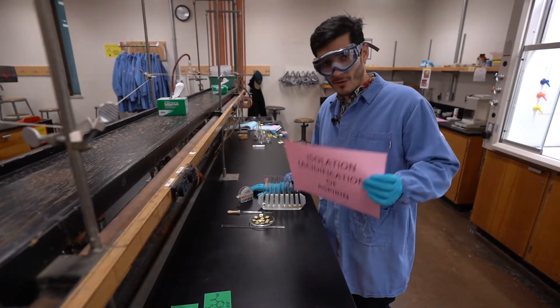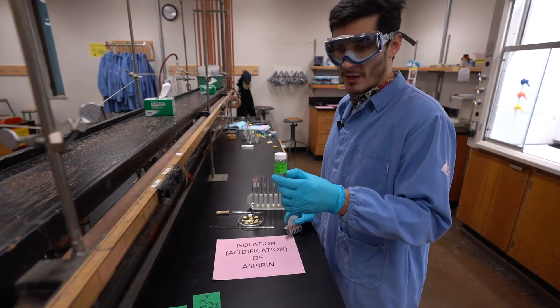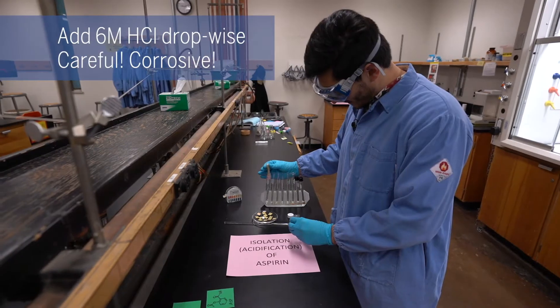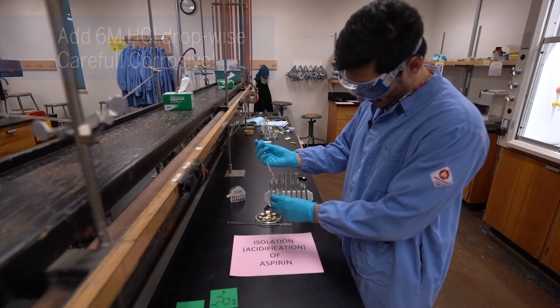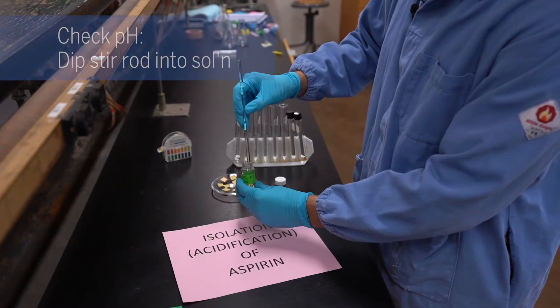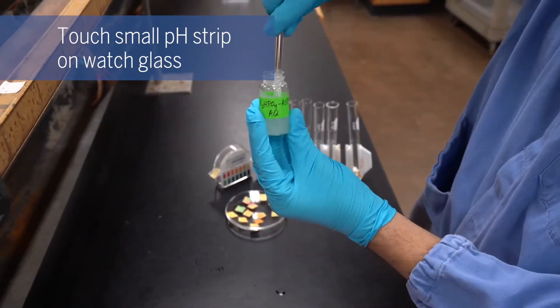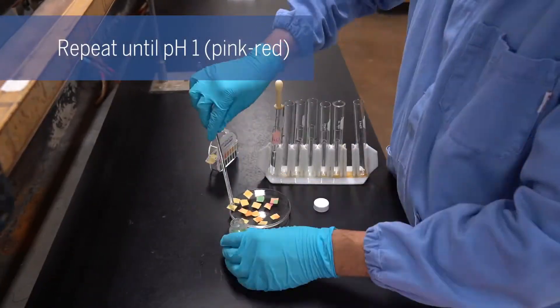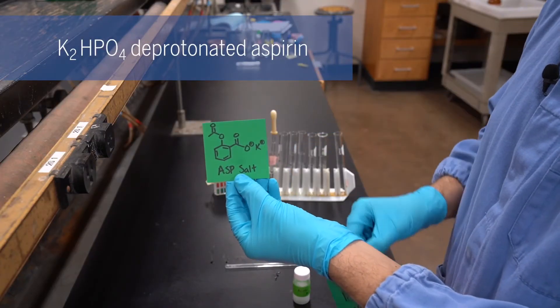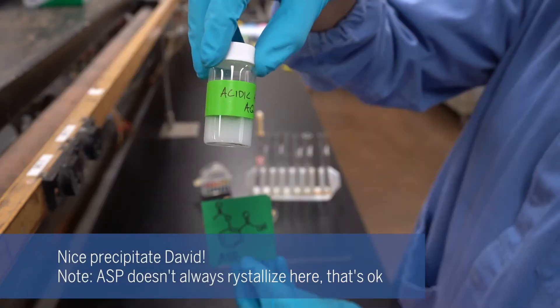Now we're on the acidification of aspirin step. What we're going to try to do here is take our aqueous layer that we separated and bring it down to a pH of 1. In our separation funnel, we added potassium phosphate as a weak base to deprotonate our aspirin into the aspirin salt, and right now we just added hydrochloric acid to reprotonate the aspirin and get it to precipitate out of solution — that's what we're seeing here as a cloudy mixture.